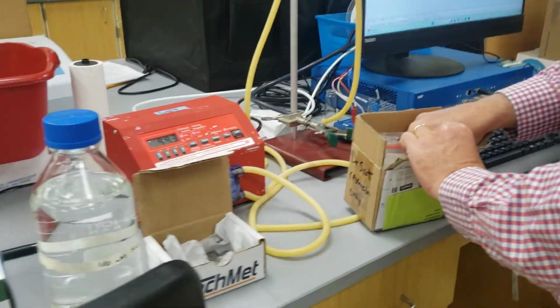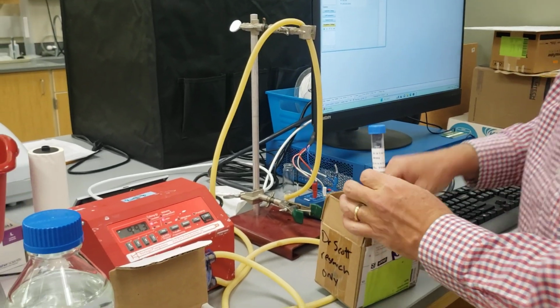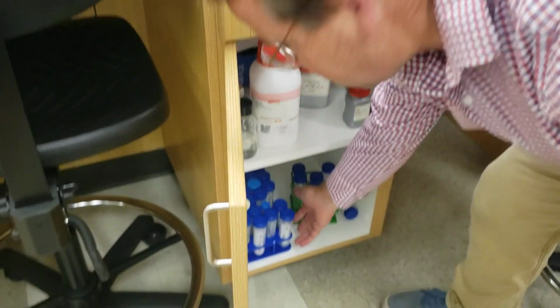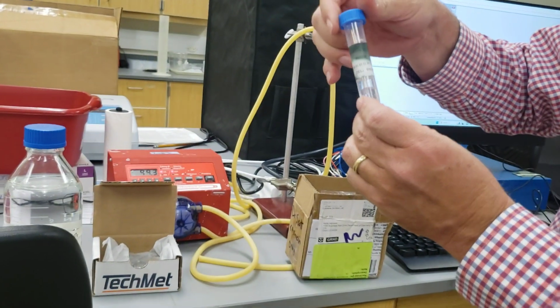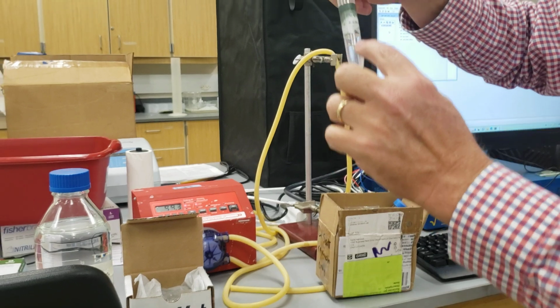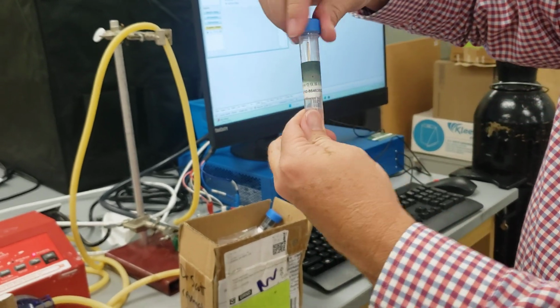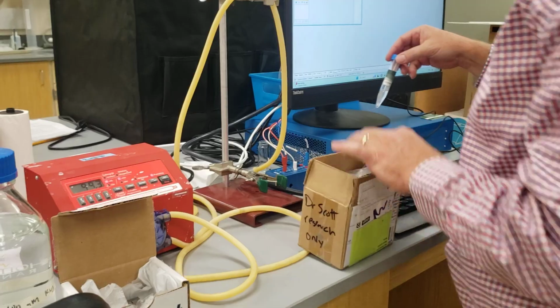We're going to get our reference electrode. The reference electrode that we're using is right here. It's kept in this little blue rack, in there. See how it's stored? Just like that. We don't want this to tip over and spill the salt water solution. This is a concentrated solution of potassium chloride on this electrode piece right there. So we keep it standing straight up and down like that.